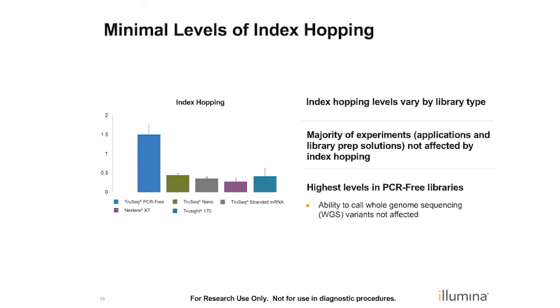So this is another experiment that we've done where we've taken several of our different flavors of preps, either PCR-free, TruSeq Nano, TruSeq stranded mRNA, the Nextera prep, or TruSight 170, which is one of our most recent enrichment preps. And this just compares the total level of index hopping from these various preps. And as I've referred to already, PCR-free tends to have the highest level and seems to be most sensitive to levels of adapter contamination and cleanup problems compared to our PCR preps, which generally have very little free adapter in them at the end of the process. But PCR plus preps tend to have much lower levels, in the range of 0.2 to 0.5 total, compared to PCR-free.